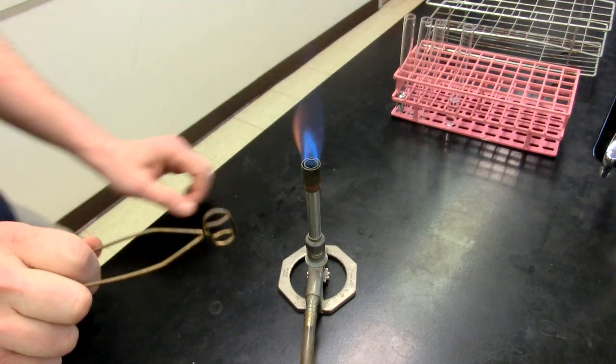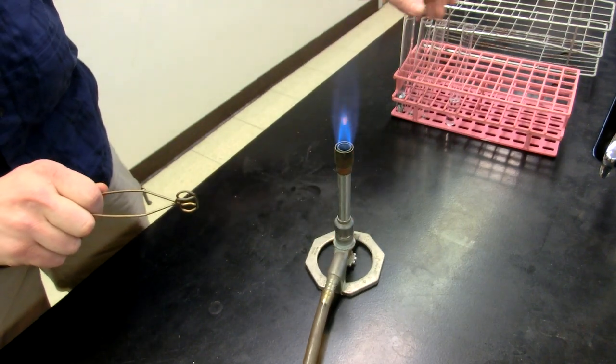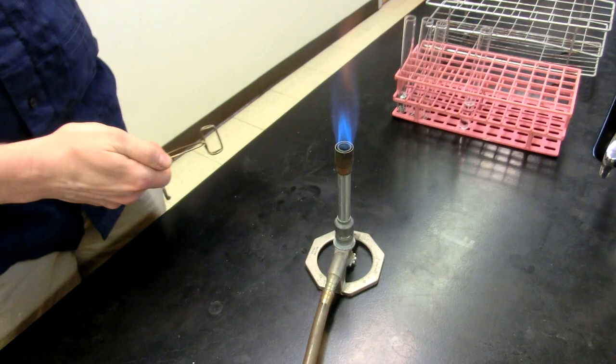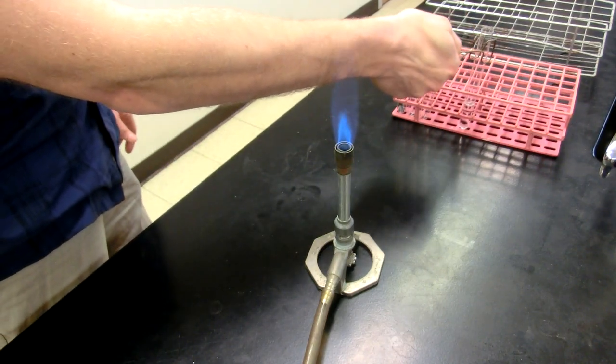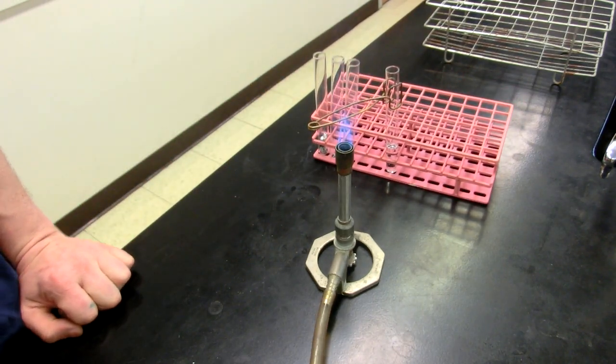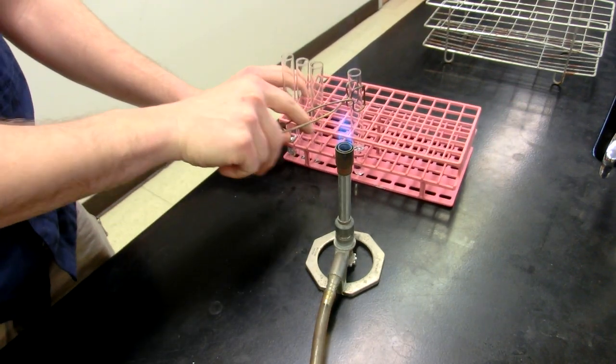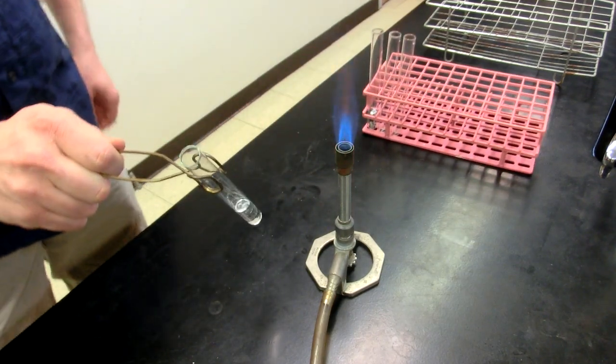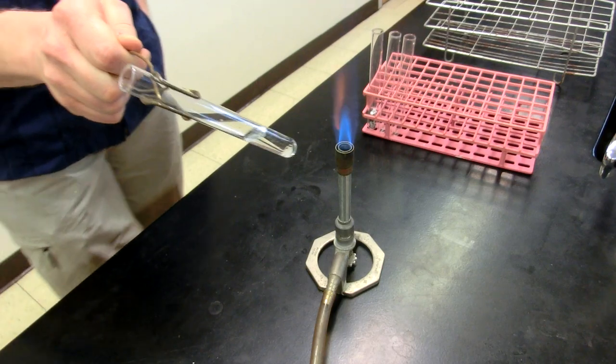All right, so let's go ahead and do proper technique for heating up a test tube full of, that just happens to be water by the way, but it could be any liquid. You'll notice that I have it on the test tube holder and I'm going to grab it with my finger going through the section of the test tube holder and picking it up.